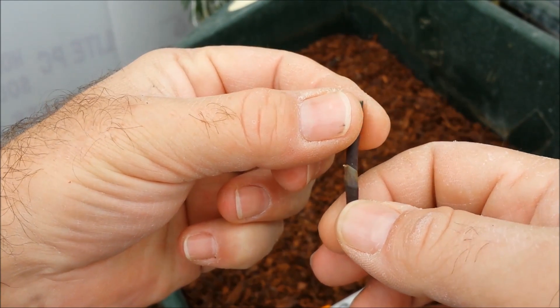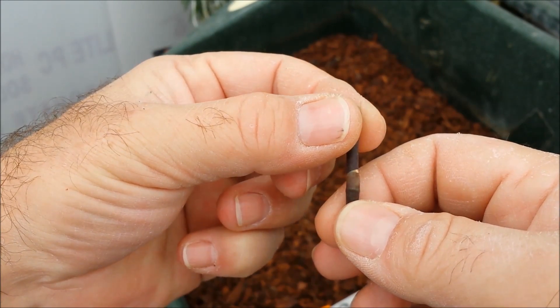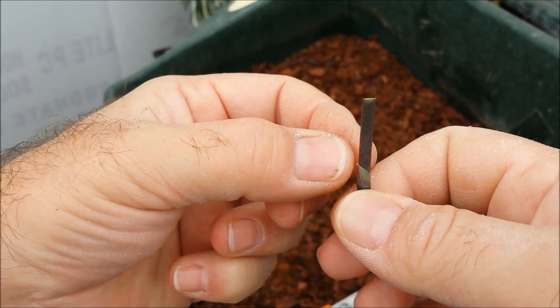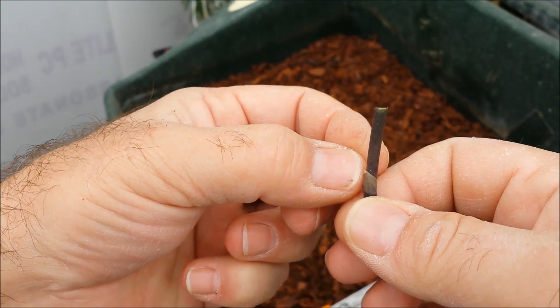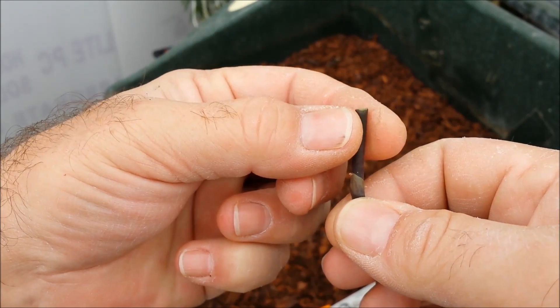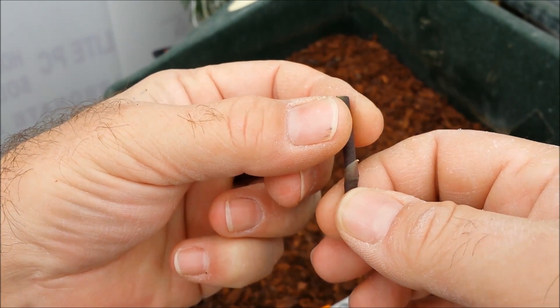Now what I'm going to be doing with these now is sterilizing these stem sections and removing the bract or sheath that covers the bud that's underlying this area here, and I'll show you that in more detail in a second.